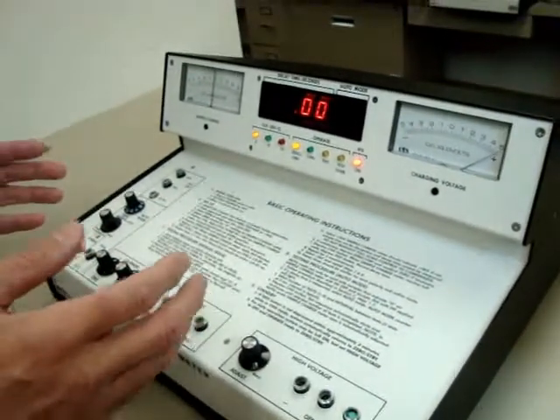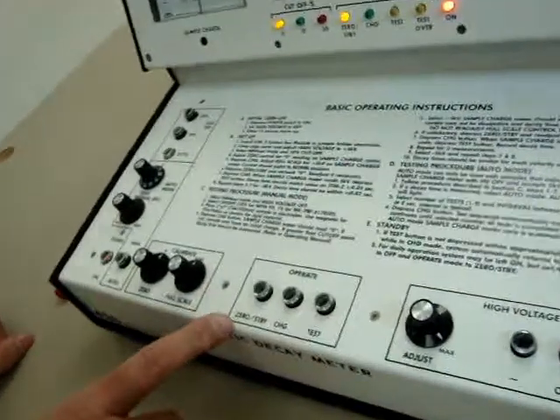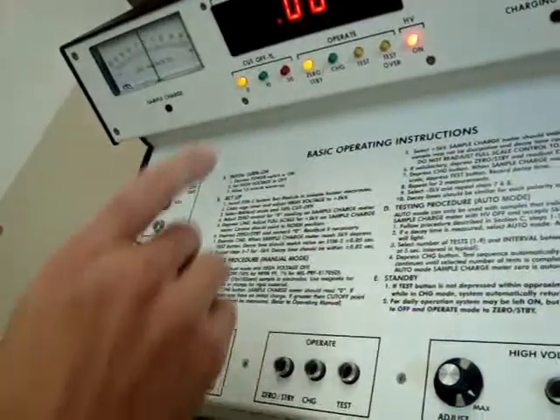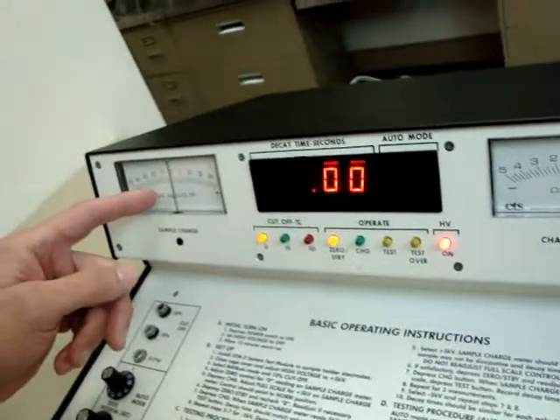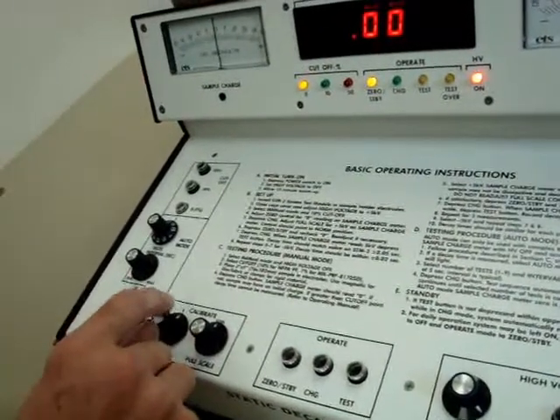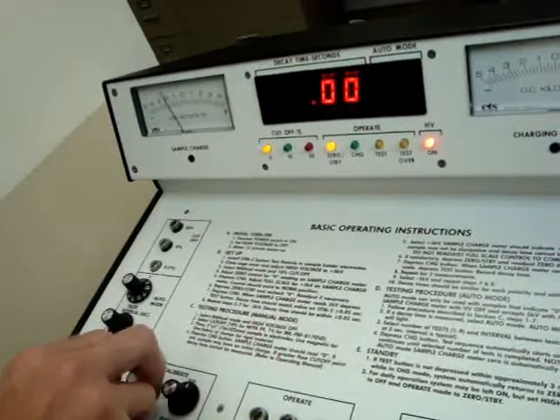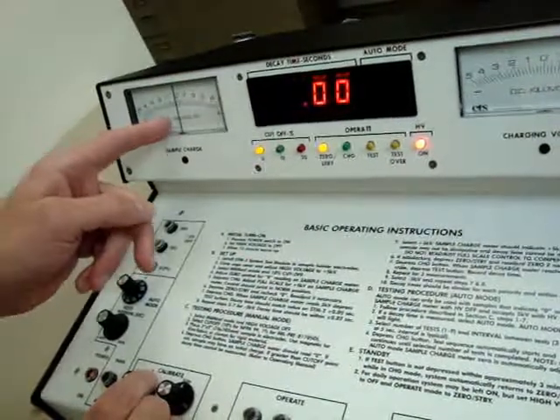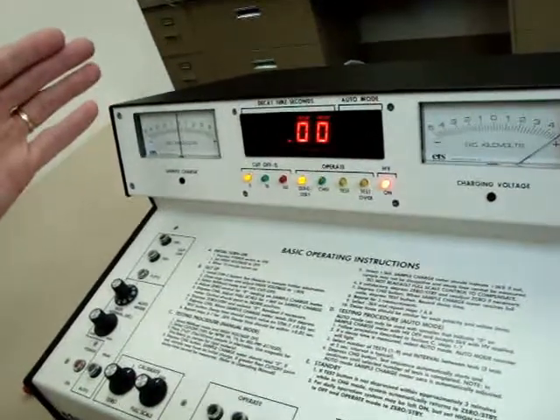Next, we're going to do a test, coming to this section of the 406. First, we want to look at our zero standby. Zero standby is just what it says — it's waiting and standing by for us to start. We have a corresponding zero-standby LED. While it's in zero-standby mode, notice the sample charge meter should be set to zero. We do that using the zero calibration knob. Turning it clockwise moves the meter in the positive direction; counterclockwise moves it into the negative section. We want it at about the 12 o'clock position so the sample charge meter reads exactly zero.